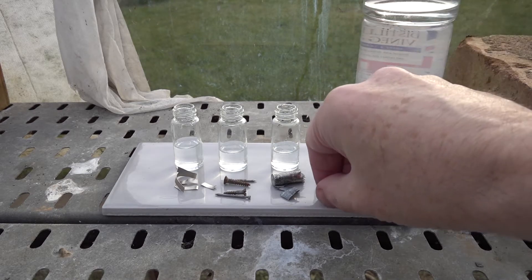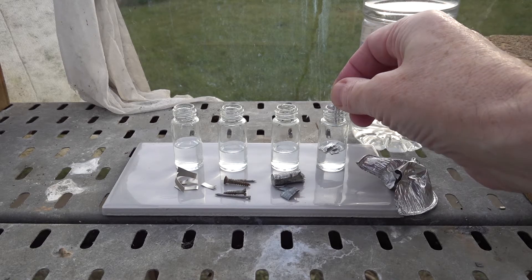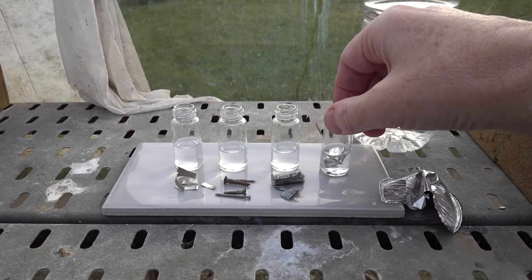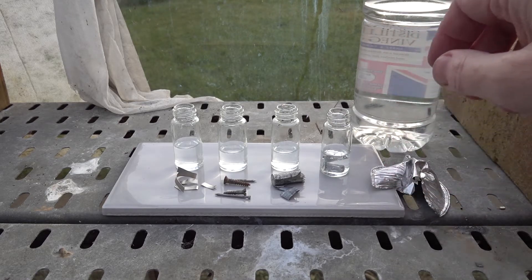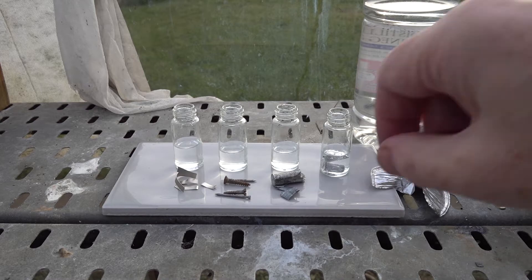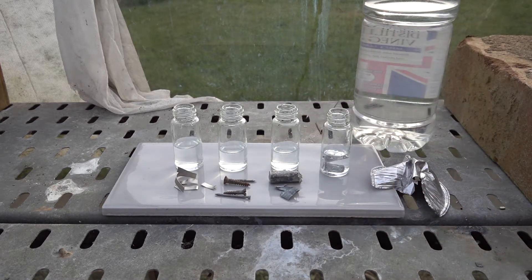First the aluminum, floating on the surface, let's give it a shake. Nothing much appears to be happening yet.